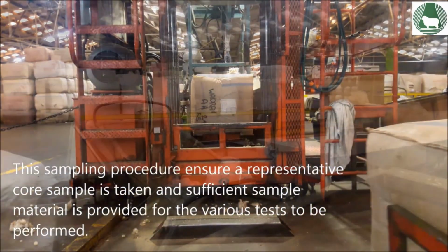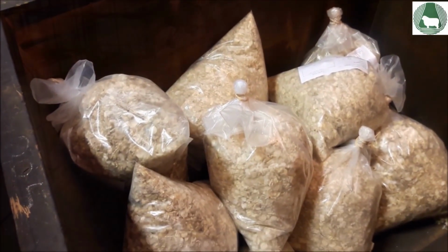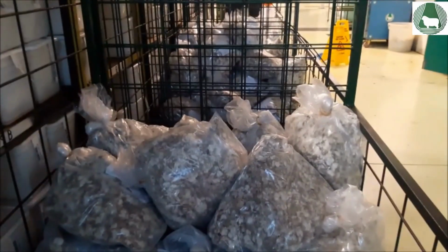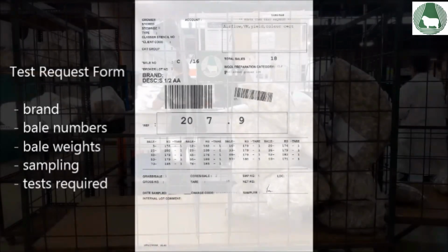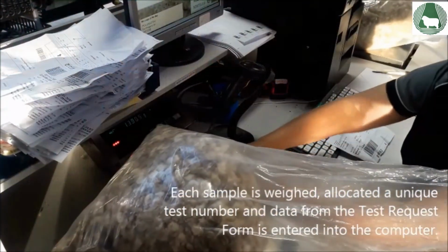This sampling procedure ensures a representative core sample is taken and sufficient sample material is provided for the various tests to be performed. Each sample bag contains the core sample taken from each bale in the lot. Included in the bag is the test request form, which sets out the details of the lot being tested, such as brand, bale numbers, bale weights, who performed the sampling, and the types of tests required. Each sample is weighed, allocated a unique test number, and data from the test request form is entered into the computer.